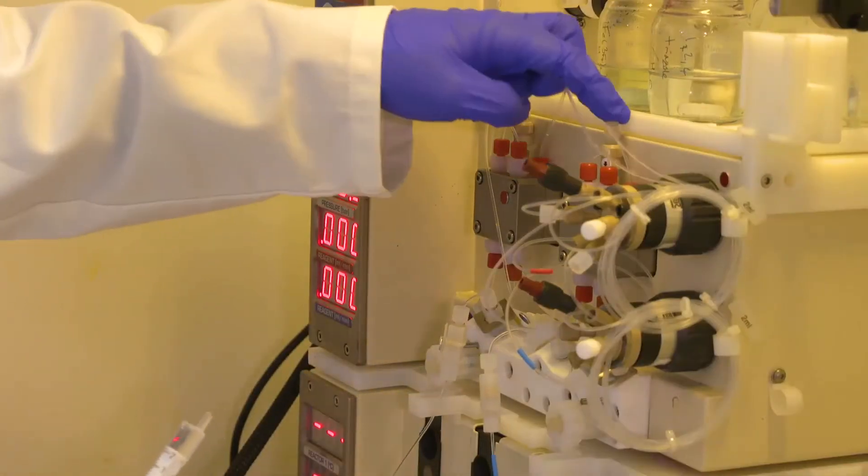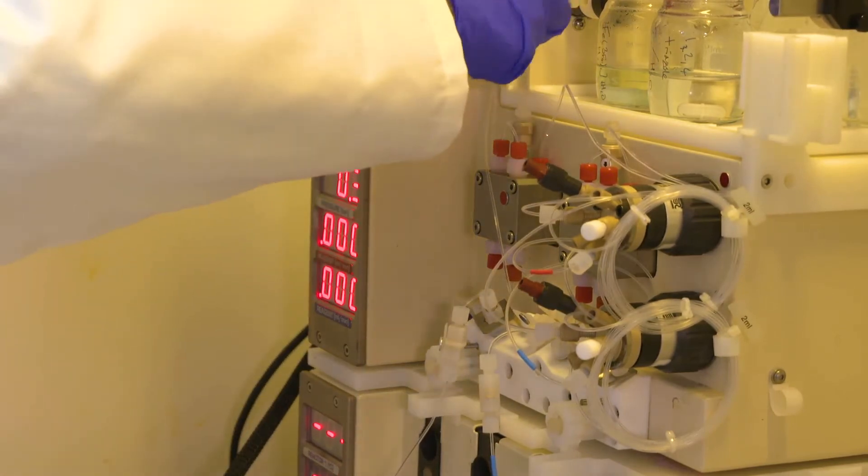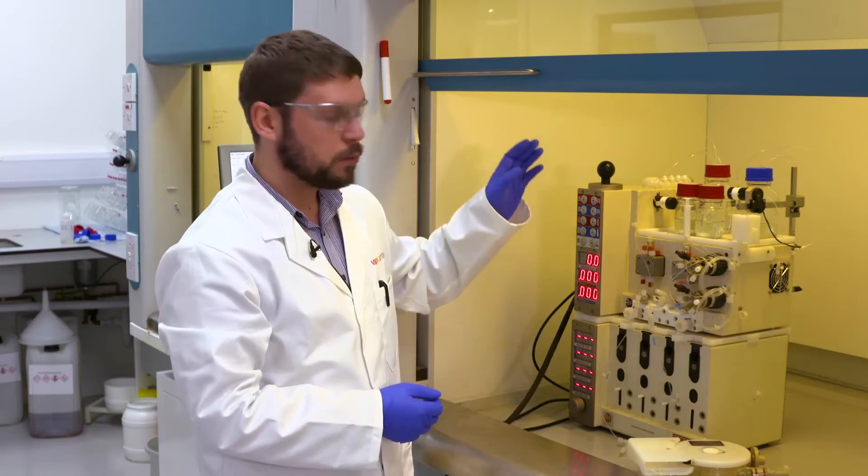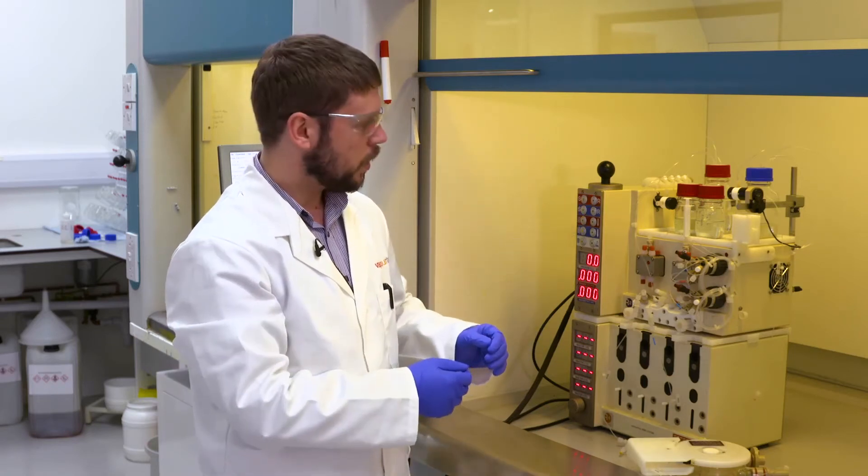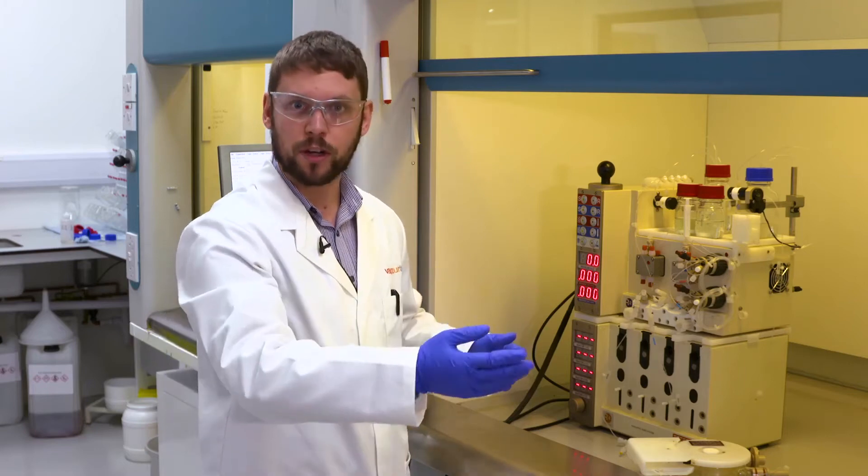Using my syringe, I use these two injector ports to fill the void behind the pump. When filling the backwash, it's a good idea to use the same system solvent as your reaction so that if any material is drawn through on the piston, it stays dissolved and you can wash it out later.